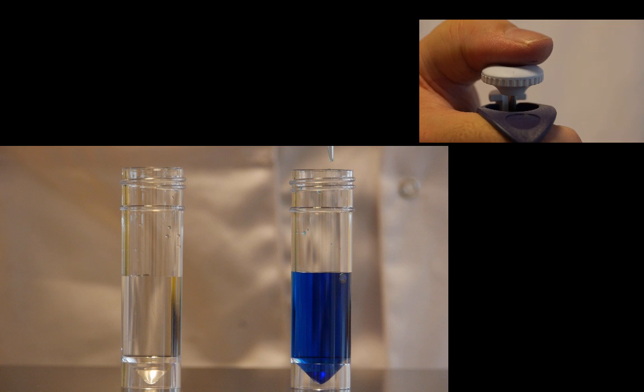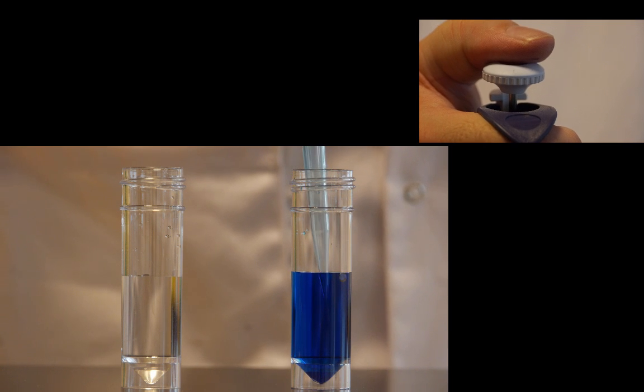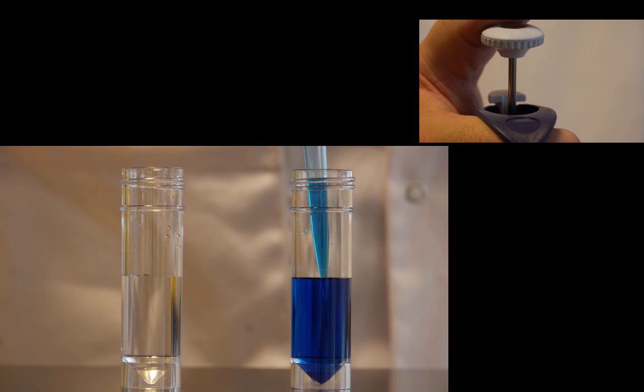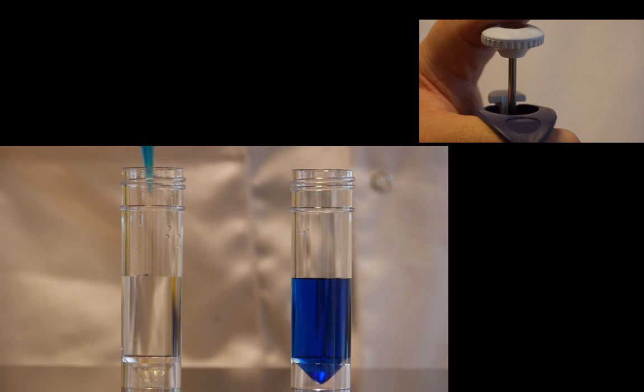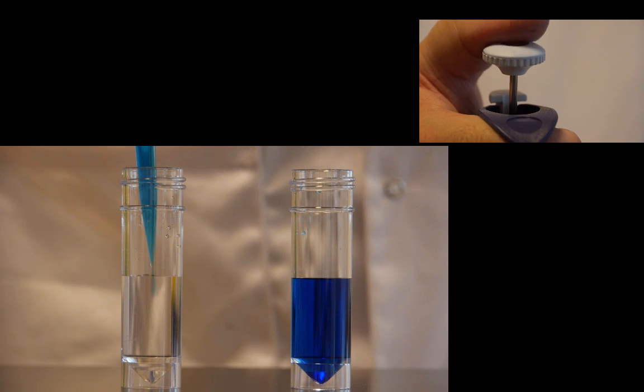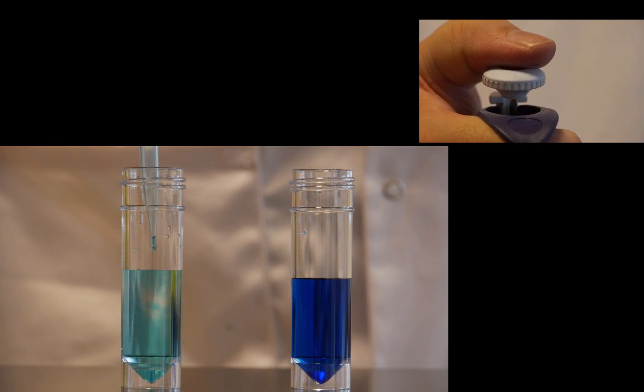Here you can see the actions together. Plunger comes up, liquid is taken in, we move over to the other container, push down to that first stop, pause briefly and then push through.